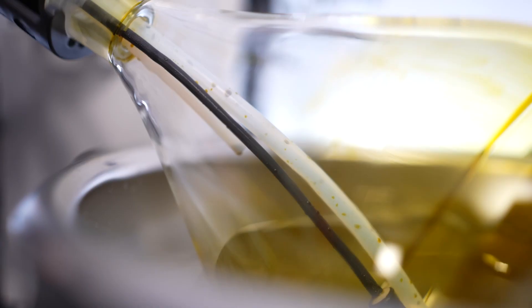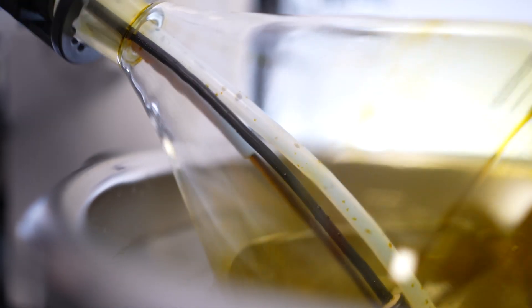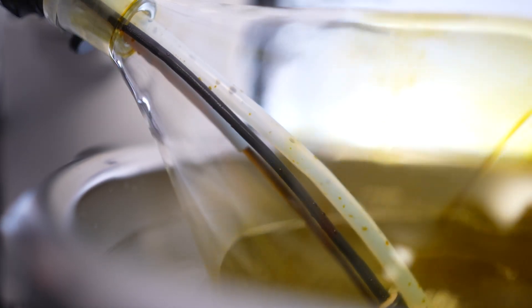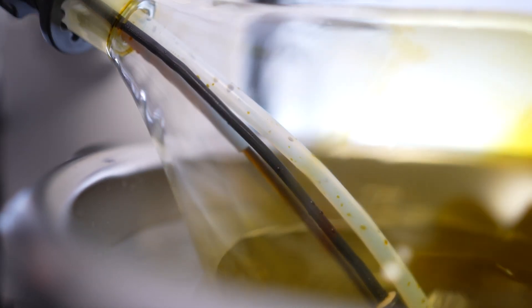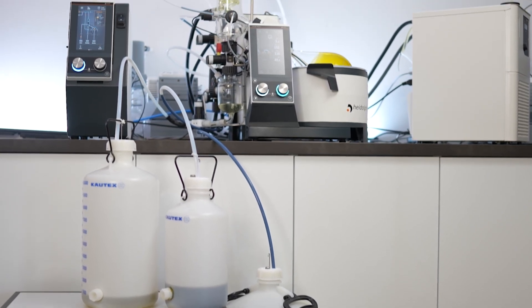In a usual batch process we can fill the evaporation flask by a maximum of around 50%, which means we could process 500ml with a 1L flask in one run. The Distimatic Pro can automatically refill this flask and can empty the distilled solvents as well as the residue in the evaporation flask, modifying a rotary evaporator into a 24/7 solvent recovery station.